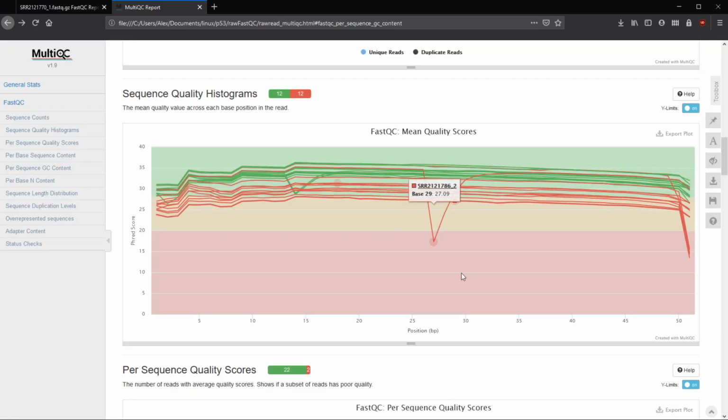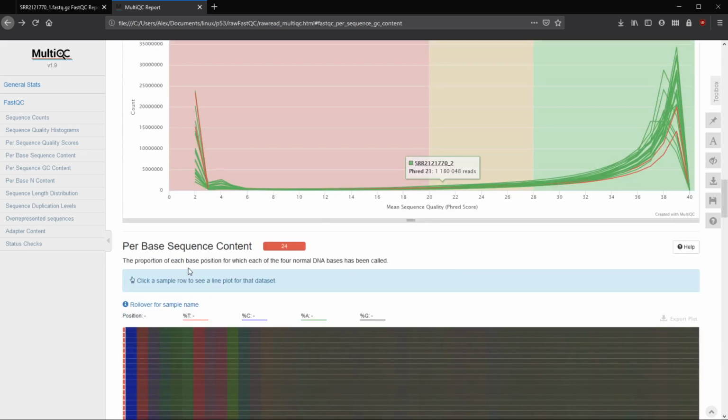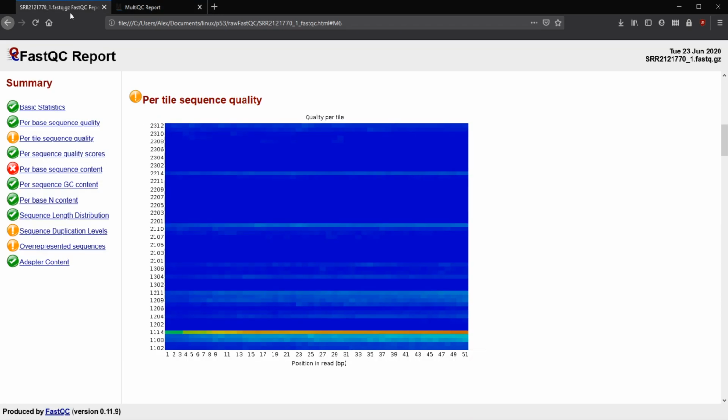And in some of them, I don't know if we have, we're looking for per tile. So it doesn't look like this keeps track of per tile, but sometimes you'll see just red, like deep red, like you see with the X across the whole thing. And that means that flow cell was just poor compared to the average of all the base calls at that location, but for all base calls.